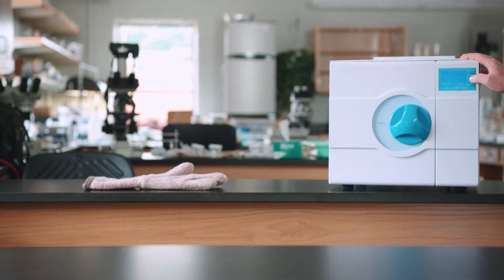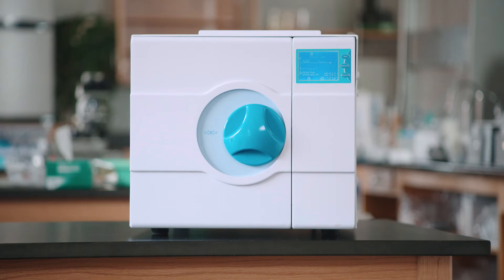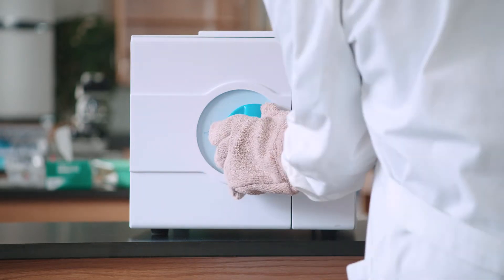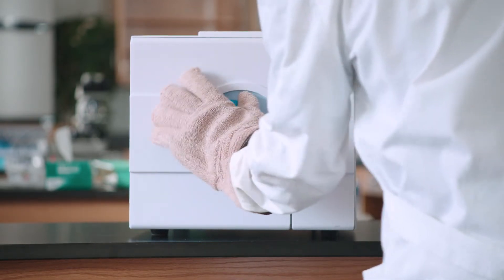If you have an autoclave, sterilize for 15 minutes at 15 pounds of pressure. For seawater media, use filter sterilization as the seawater will precipitate if autoclaved.